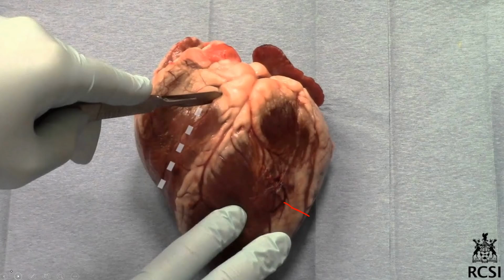So to show you how to cut it open, this person is doing exactly what I said you shouldn't do. This person has got the scalpel coming towards them. Always cut away. So you can see the coronary artery, you can see the thymus gland at the top here, okay? But I would cut in that direction, and then on this side, okay, I would cut in that direction from the bottom up to the top. You find that the meat is easier to cut through.